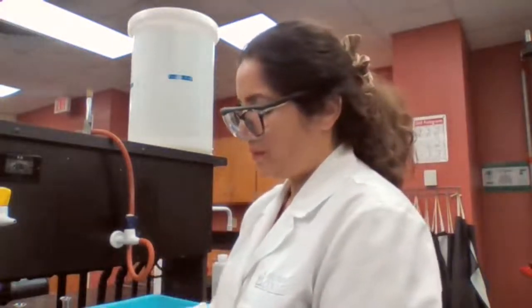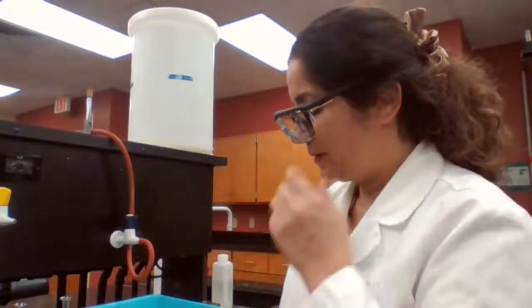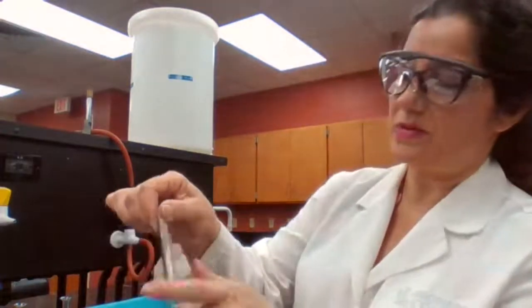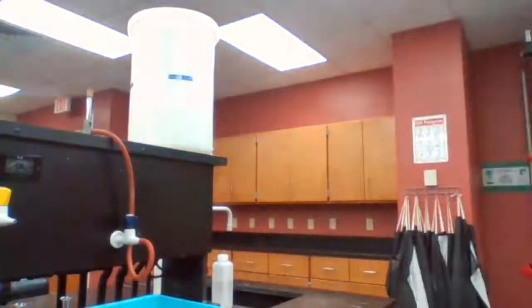So the first one is the acetone, the second one is hexane. I'm going to do one experiment at a time, so we can avoid labeling, or we have to label each one to make sure what they are, because it would not be easy for you to read the labels. So for water and acetone, we get the label for water acetone and then you go back.